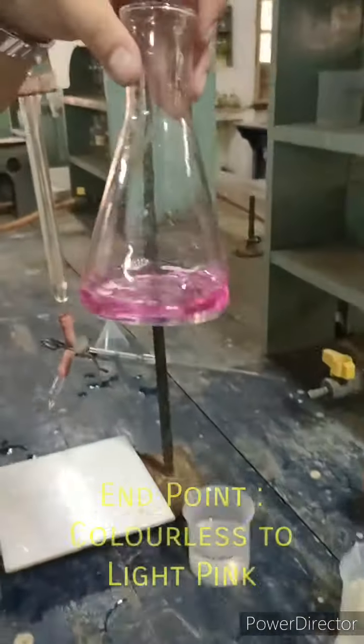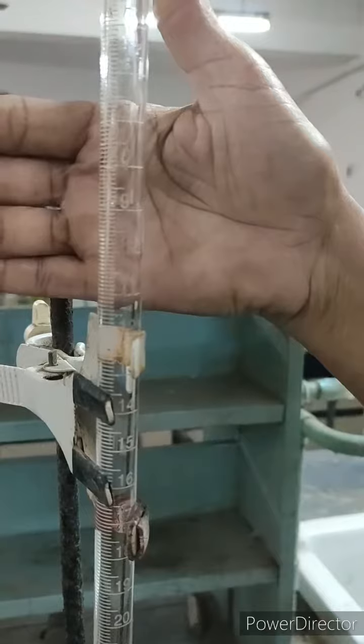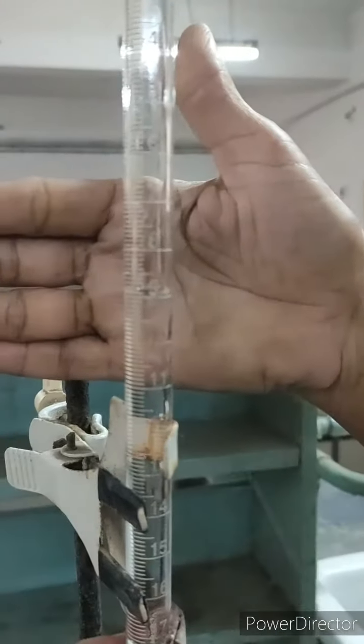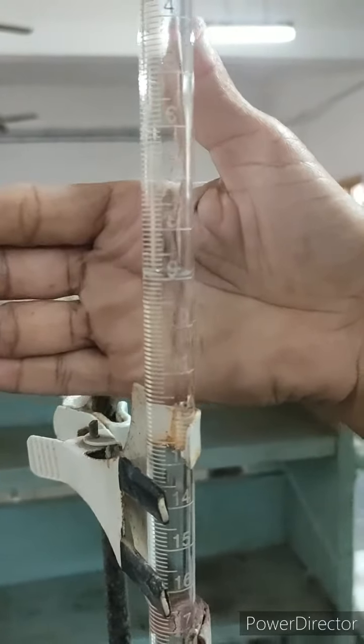Now, this is the appearance of our permanent light pink color. Now we'll notice that our reading is exactly at 9. The lower meniscus of this solution is at 9.